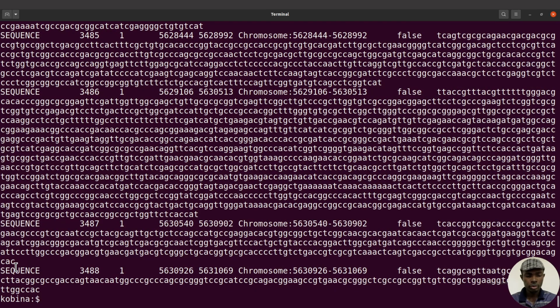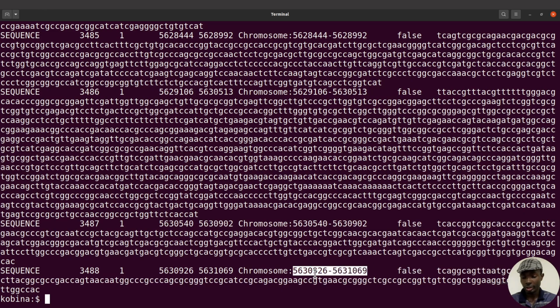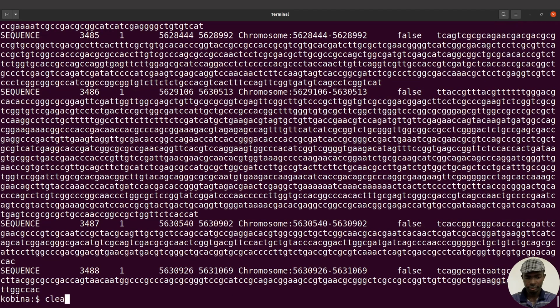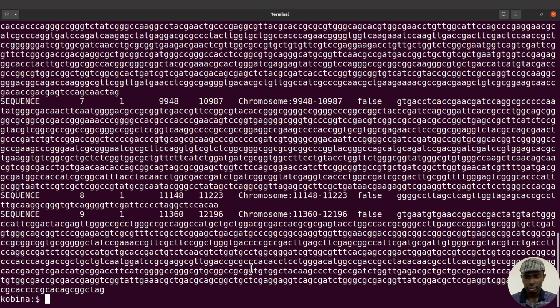So here, when we come to the example line, like this one here, you can see sequence, we can see this value 1, we can see this, and when we come here, we see chromosome, and we see the location, or the position, or the regions, let me put it that way. So here we have this name here, chromosome. But if you take a look at the reference sequence, let me just do this again. Let me just do a head first. I think that will be better.